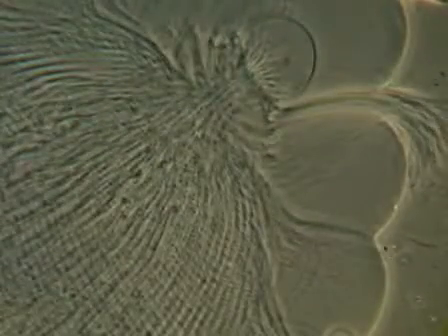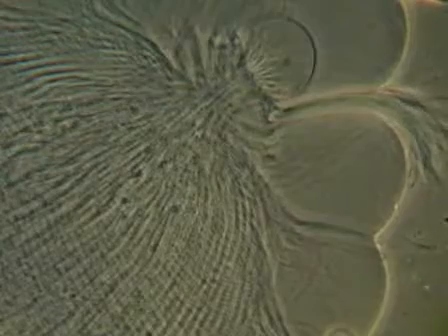Examples of other symbiosis within symbiosis: if we look at this Trichonympha, this larger protozoan that we're looking at here is sort of a squashed Trichonympha, we can see that it has these long striations that go from anterior to posterior.